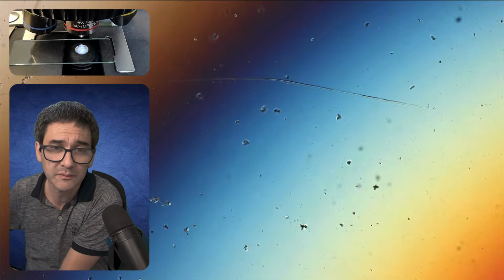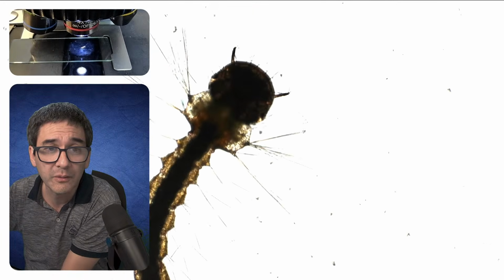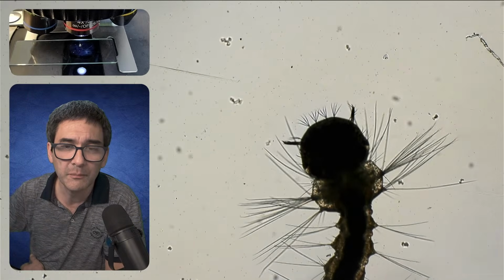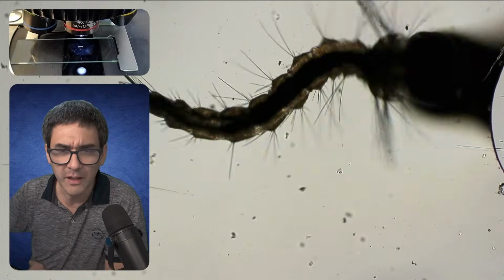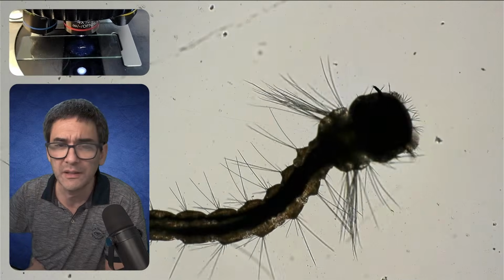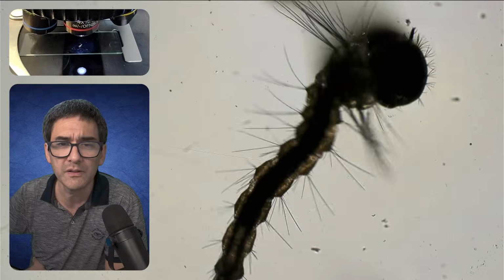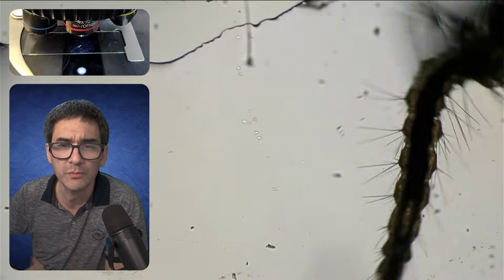Okay. Where is it? Of course, it's way too quick. Here we go. Okay. You see. Here it is. Looks a little bit too dark. Should I try that? I could try to add a cover glass. It's going to squeeze it a little bit, but it is a concave slide. So maybe it's not going to crush it completely, but it's also going to limit its movement a little bit.